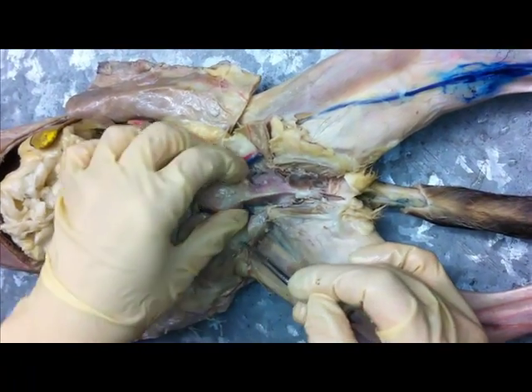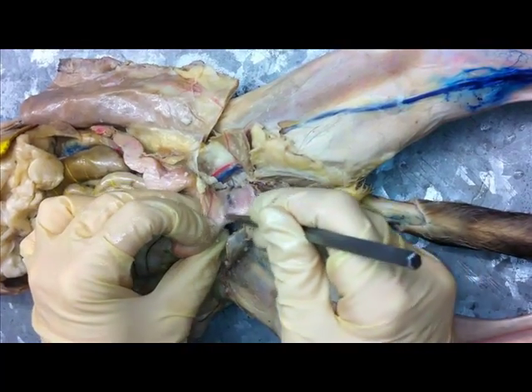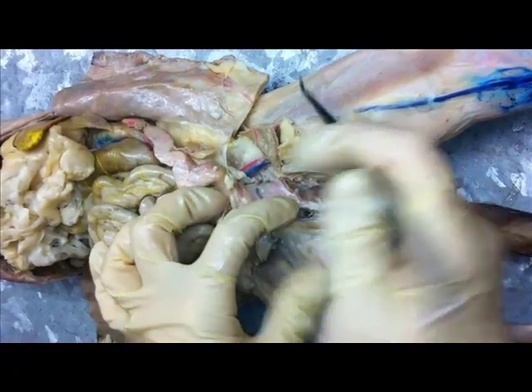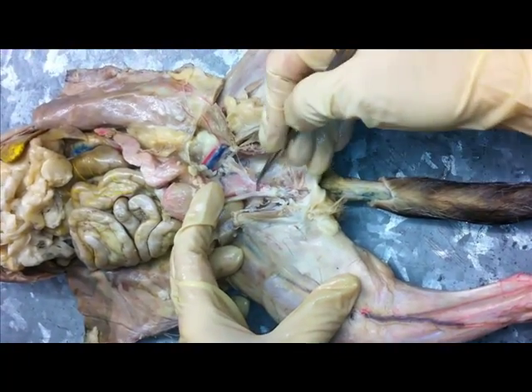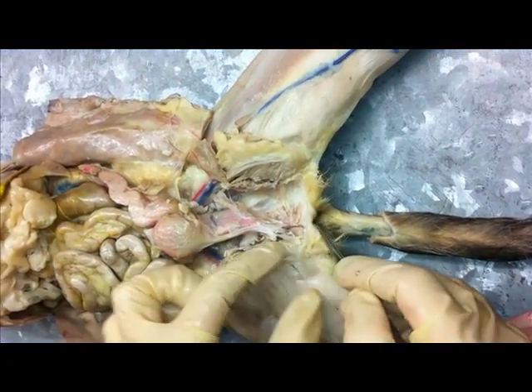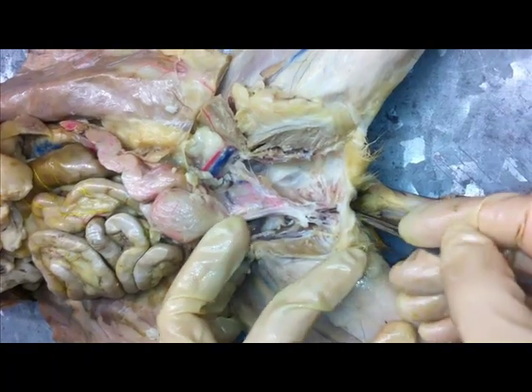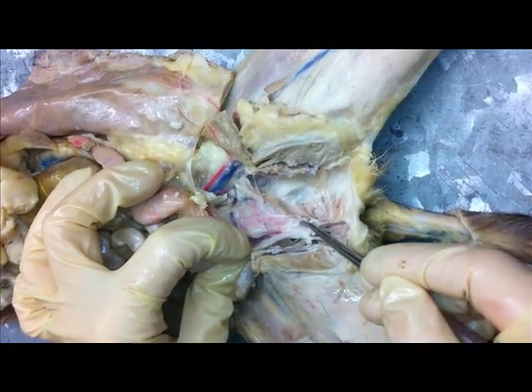Inferior to the urinary bladder, you have the urethra. If we get the probe right behind that, just behind the urethra, is the vagina right there. If we continue to dissect down, the urethra and the vagina combine to form — when we kind of split this open — the urogenital sinus right here. If I put my probe in there, I'll see it because that sinus has been split open. I have my probe in the urogenital aperture or the urogenital orifice, because this is where the cat urinary tract combines with the female reproductive tract of the cat.